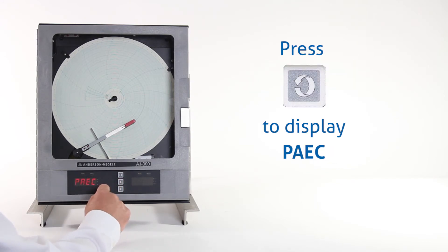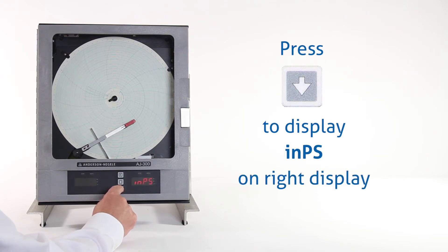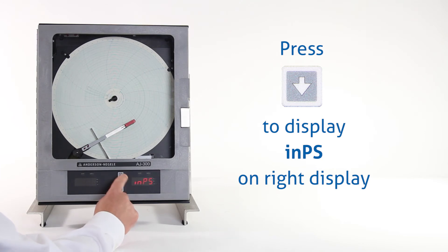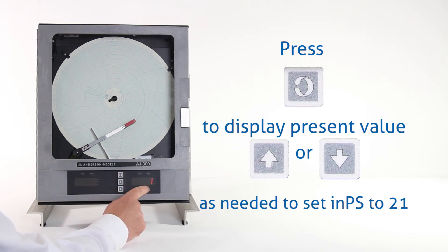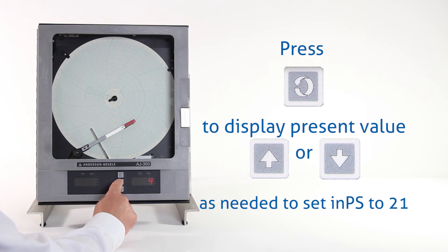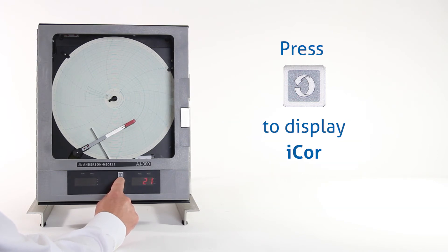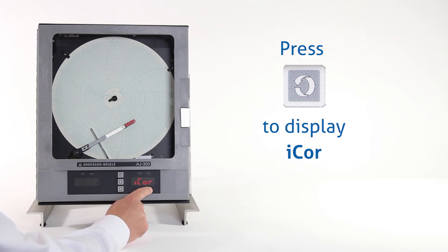It goes to PAEC. We now want to hit the down arrow key to get over to INPS on the right-hand display. Once we have INPS, we're going to hit the scroll key, and again we need to change this value to 21, so we're going to use our up arrow key. Once we have this set at 21, we press the scroll key to see ICOR.